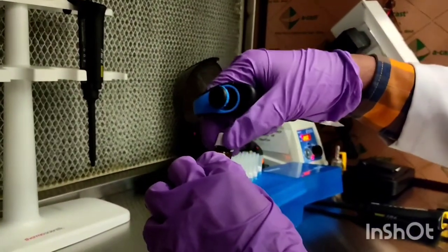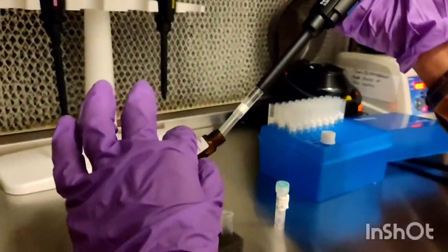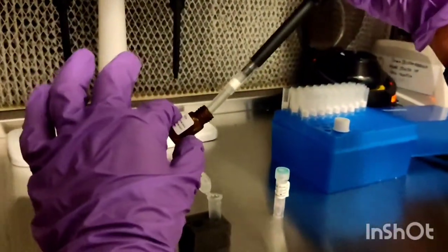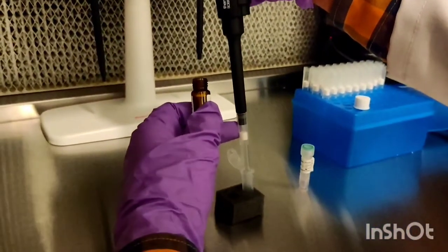The master mix was in lyophilized form. We already reconstituted it to save time. So first of all, we'll take 270 microliters of master mix in the MCT.